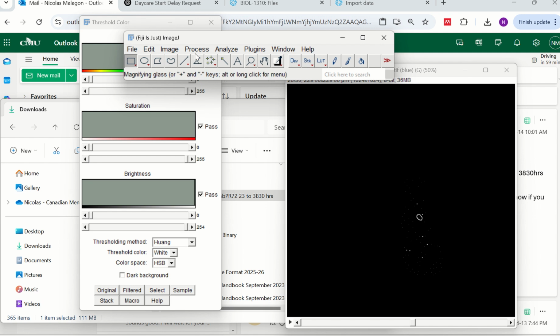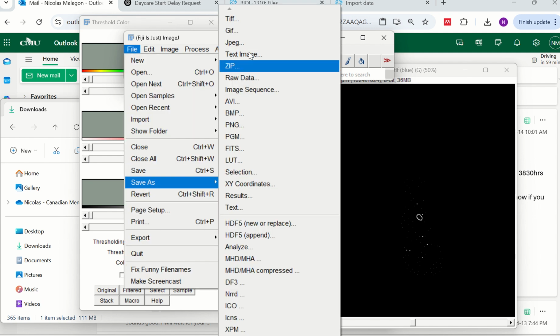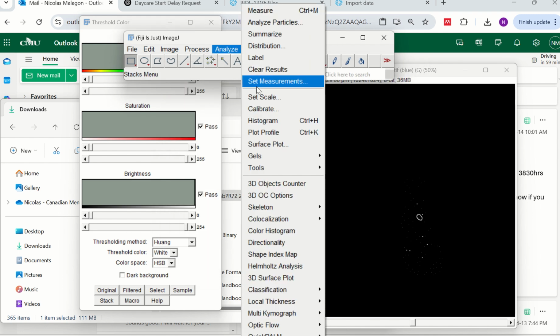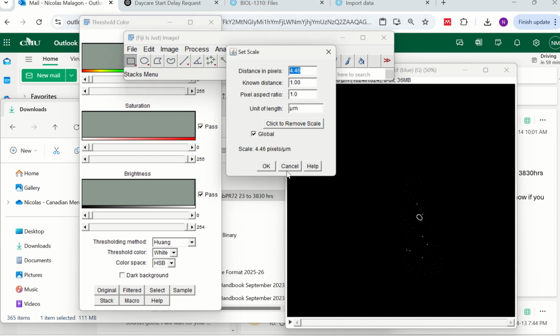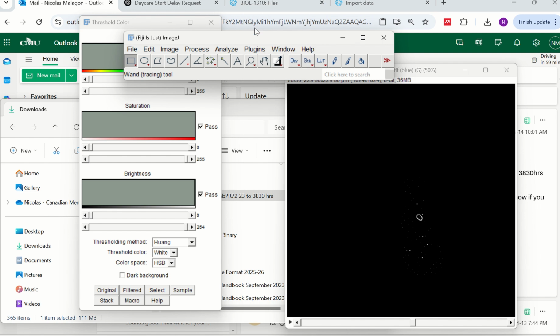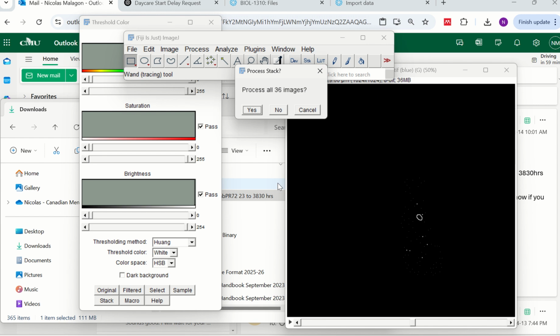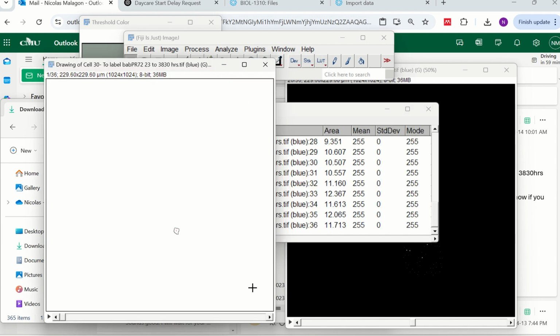So you don't have to repeat it, you can save it as binary. Then Analyze, this is already set up, so this is perfect. Analyze Particles. So look, Display Results, Clear Results. This is good. Outlines, and here you can put, if you want, 1 to infinity, so all the dots are not going to be measured. Include all of them, and then you keep doing all the same things.